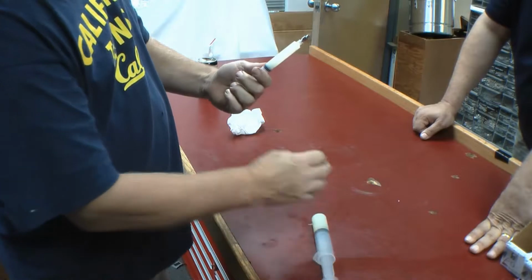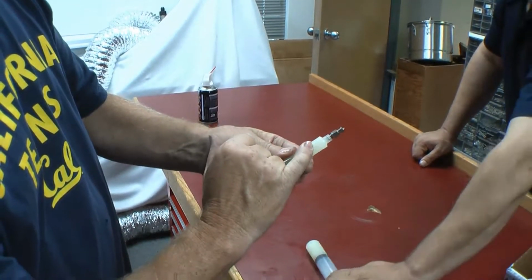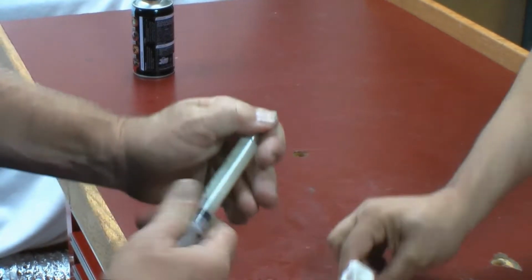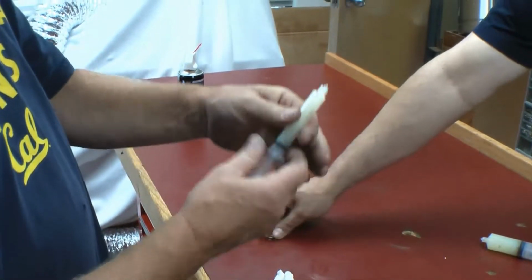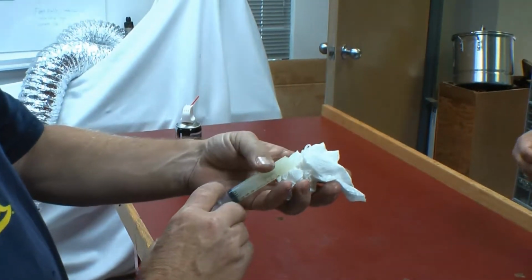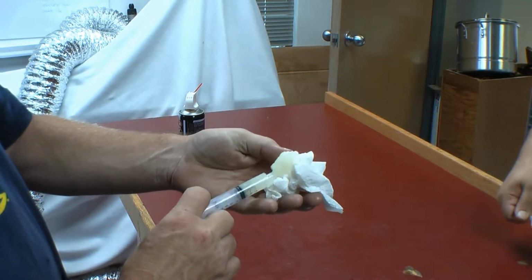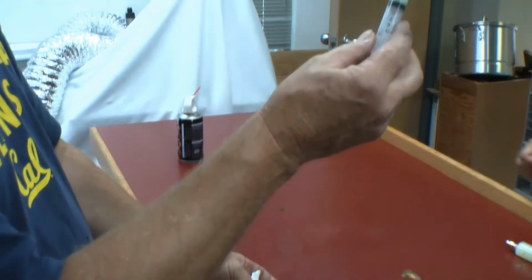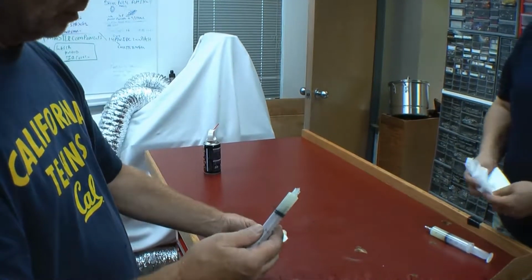Now, if you pull some air in there, as this one does indeed have air in here, that's not desired. So what I'm going to do is I'm going to undo this, and I'm going to squirt out until I feel like I'm getting to where there's no more bubbles in here. There, you heard that? Another one. There. Alright, and this will be enough for the experiment we're running anyway, and that looks pretty good. There's a few micro bubbles in there, but no major bubbles.